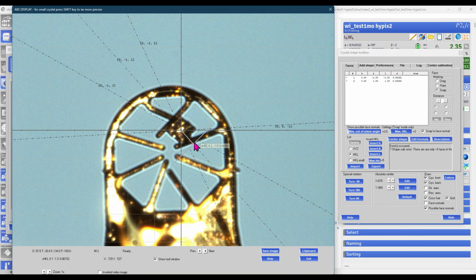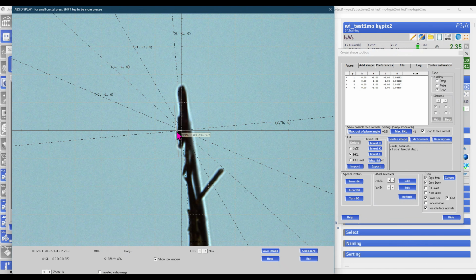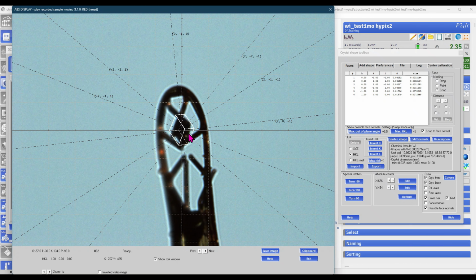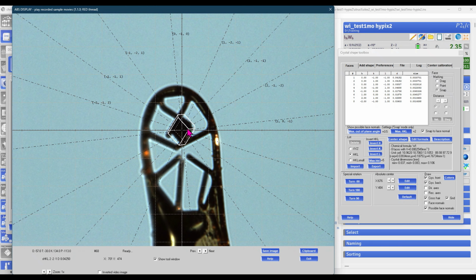We can index the crystal facets simply by dragging and double-clicking along the possible face normals of our crystal. Once we have the front face of the crystal, we can click on turn 90 to have access to the backside of our crystal, and here we simply draw the thickness of our crystal. Once we have the basic outline of the crystal, we can simply trim off the material that has been indexed too much. As tungsten iodide has a relatively high absorption coefficient, we want to do this as good as possible.